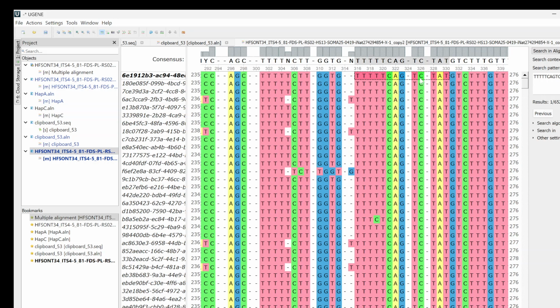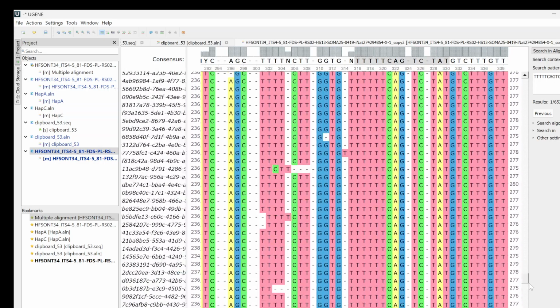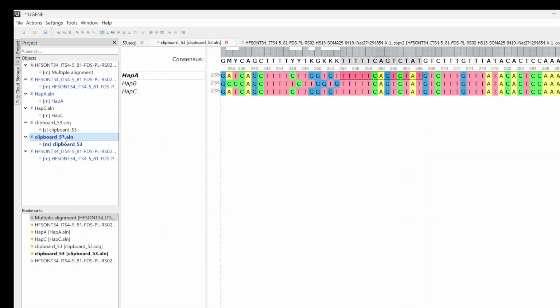Okay, so here's what I wanted to illustrate. Here's that region that came out as a bunch of gibberish in the consensus sequence. Here's where we can see you have a whole bunch that only have 5 T's here, and then we've got a bunch of 6 T's. And that shifts the whole alignment over. So here's the one with 6 T's. And actually, the one that has 6 T's over here has 5 T's here, and the one that has 5 T's here. Oops, sorry. Yeah, anyway, you know what I'm trying to say.